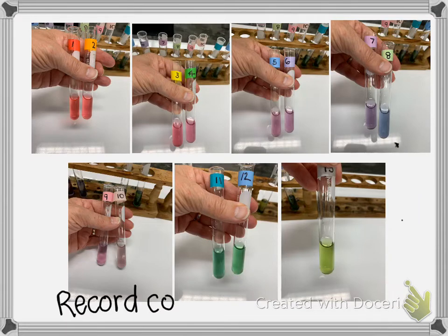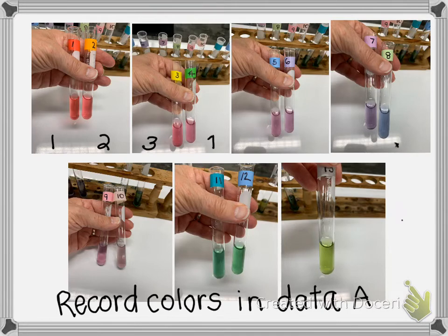Some of the colors look very similar. It's best if you can try to distinguish them, but if you can't, that's okay. It's particularly hard in photographs. It might have been a little easier in person. But you're going to record these colors, and I have them in order of pH. So I have 1 and 2, so all of the pHs up through 13. We did not have a pH buffer system of 14.